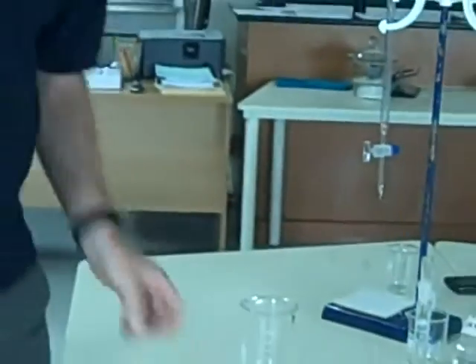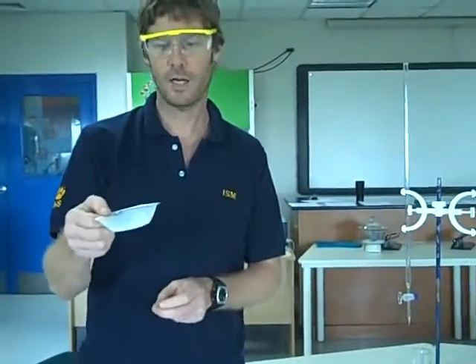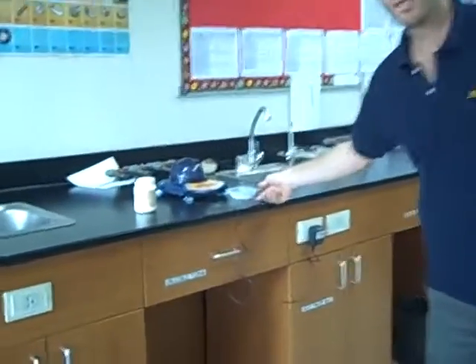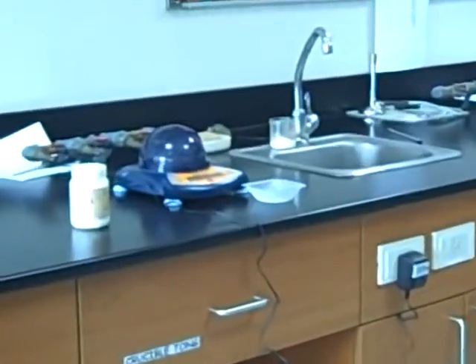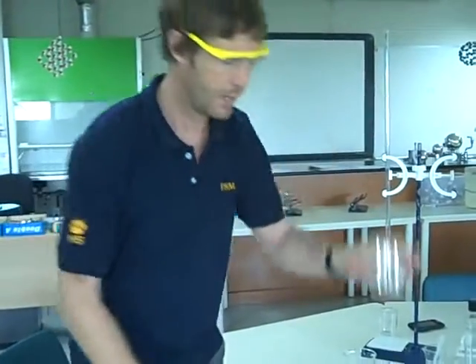Now there may remain in my weighing boat some crystals of the oxalic acid. Well, you're going to just re-weigh that so you've got the mass of the empty boat. You can subtract the two to find out how much acid you've actually added to here.